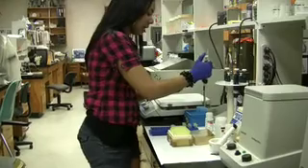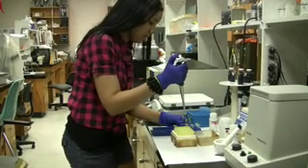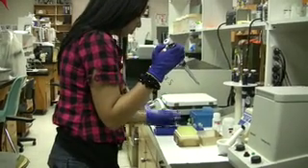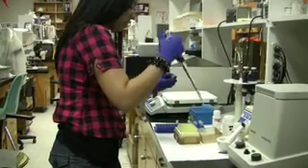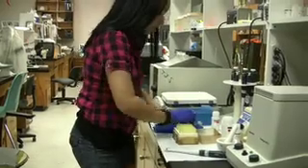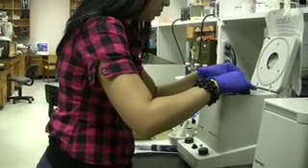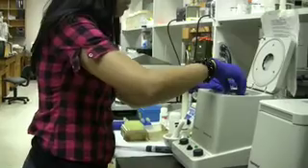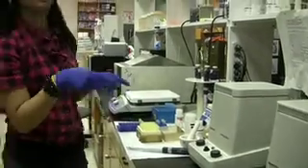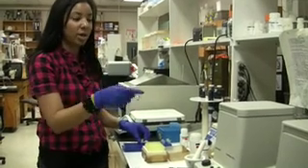I'll take the extraction solution now. I'll add 650 microliters into the white column, and the DNA binds into the white column. Then I'll do it again for the second sample. Place the two samples into the centrifuge and centrifuge them for one minute at 8,000 RPM. Then repeat this whole process over again by adding the rest of the 650 microliters into the white column, and centrifuge it again.